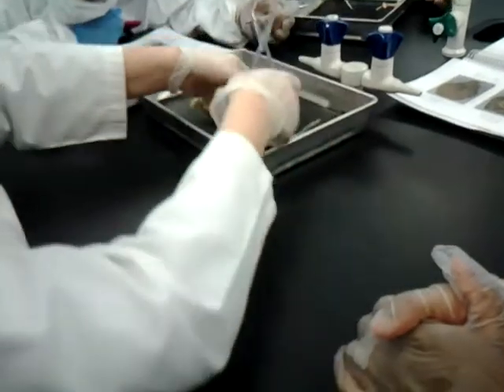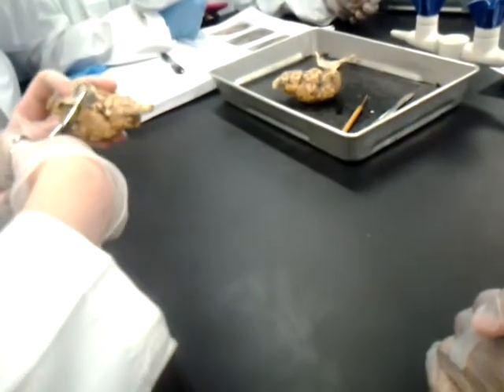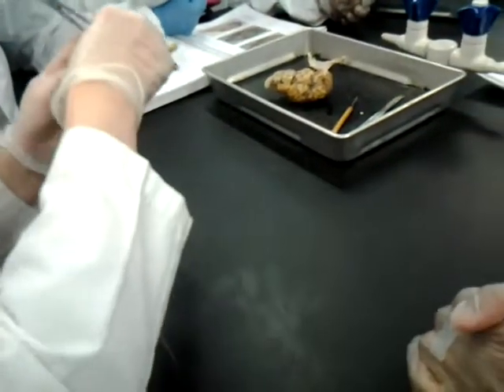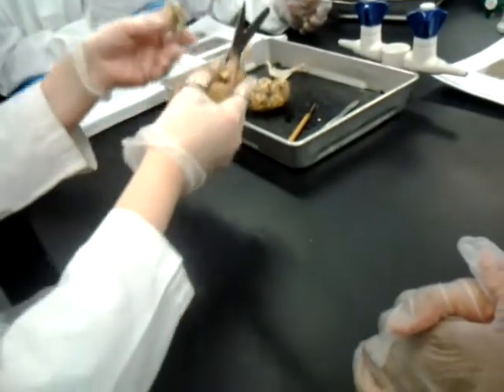Then you're going to pull up, and you're going to see some other white lines, the oculomotor nerves. You do need those, so I would again cut at the top so you don't pull them off. Those are the oculomotor nerves, I'll go back over it. And then the rest is capillaries and pia mater I don't need, so just take it off.